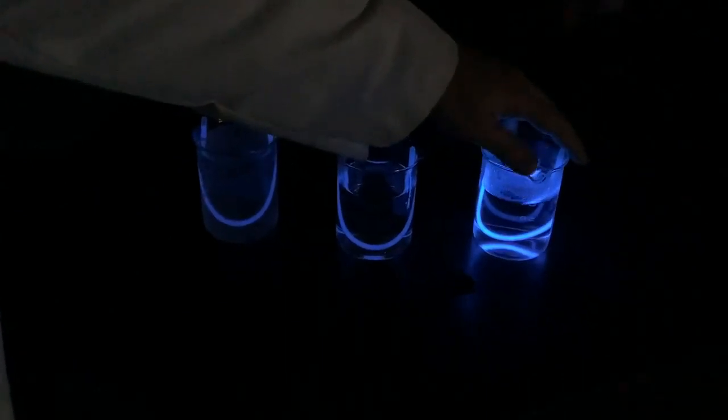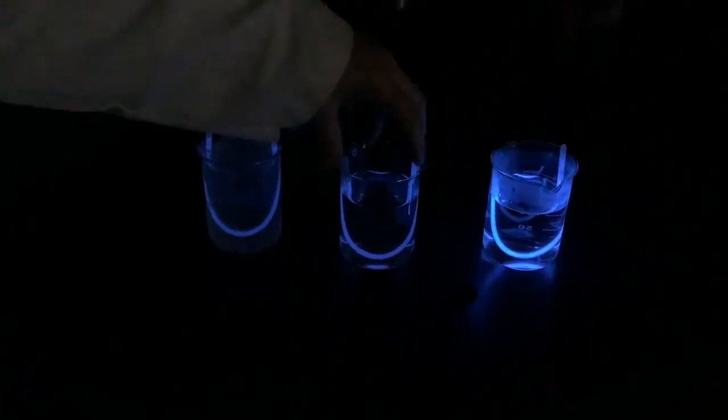The point here is, this is an example of chemiluminescence using a chemical reaction. The energy contained inside of chemical bonds is released as they're broken and reformed. That energy is captured and used to excite an electron to a higher orbital, and as it returns to its ground state, it emits heat and light. So I have some cool room temperature water, some ice cold water, and some hot water, and you can see clearly this hot water one is much brighter than all the rest, and the dimmest one by far is the one in the ice water.